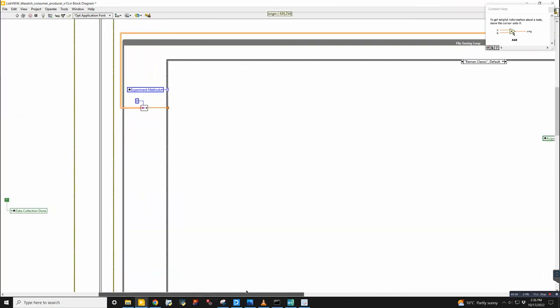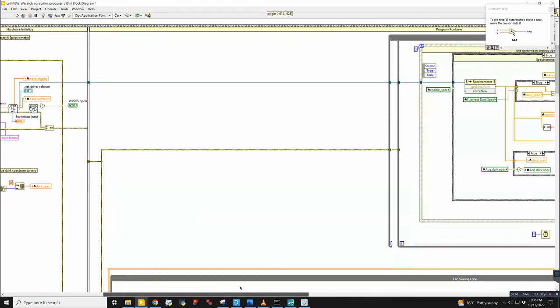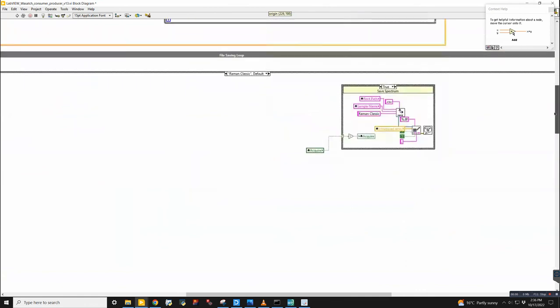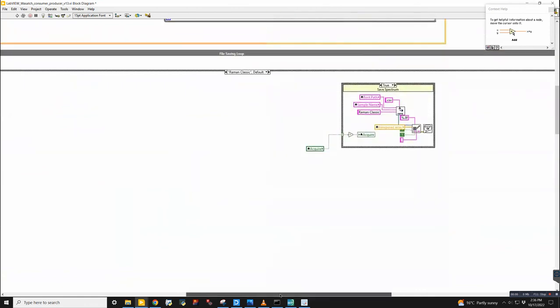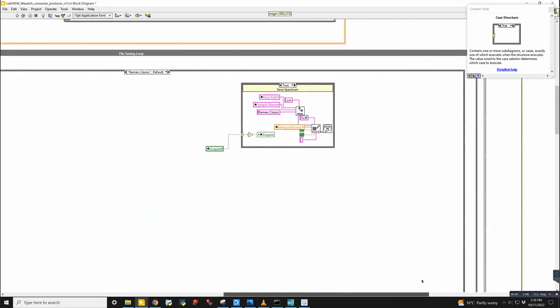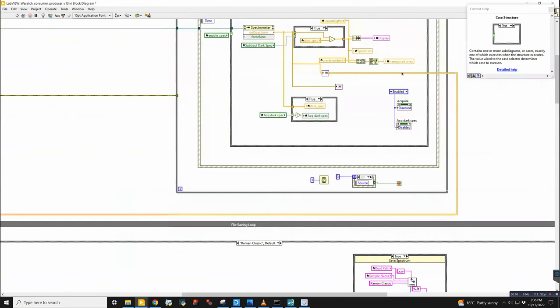Okay. So in the case that you click save data, well, this is always streaming data. Every spectrum gets streamed into this file saving loop. Here, in this case, we're not actually taking any data from this channel writer. We have data that is being sent into a local variable here.